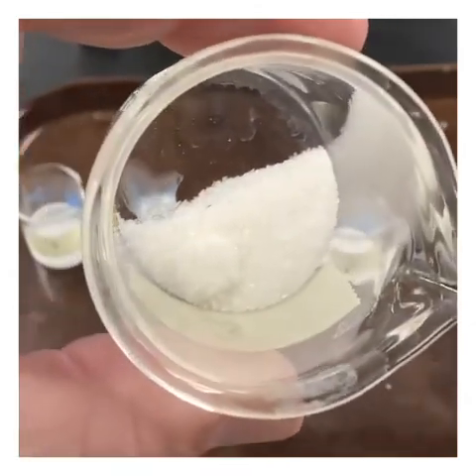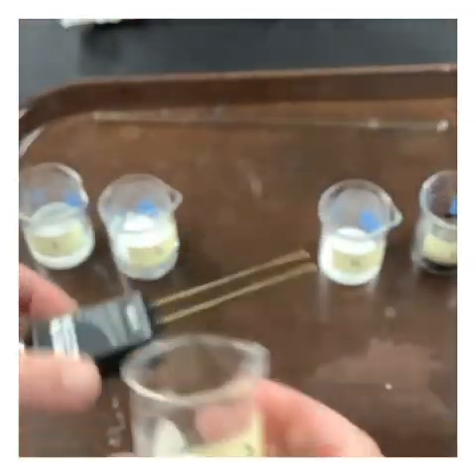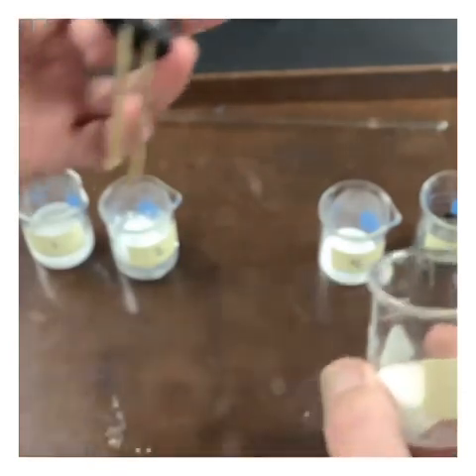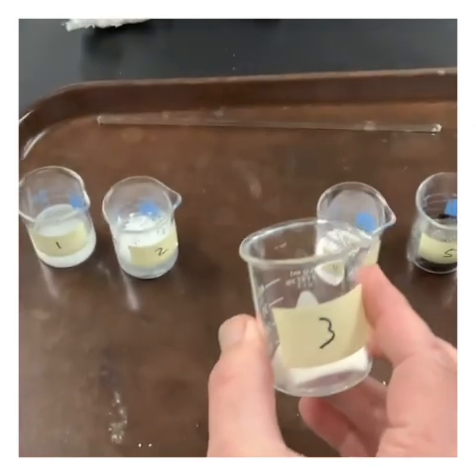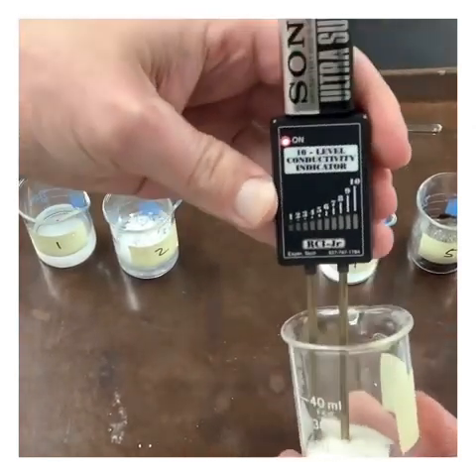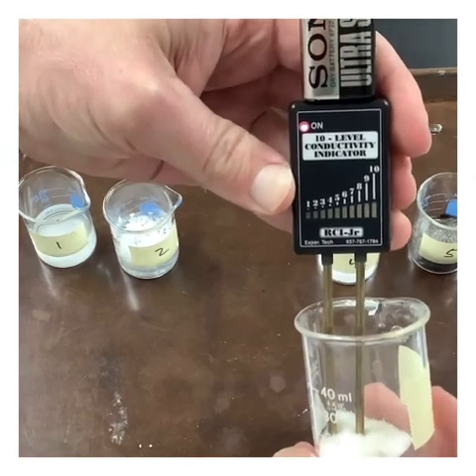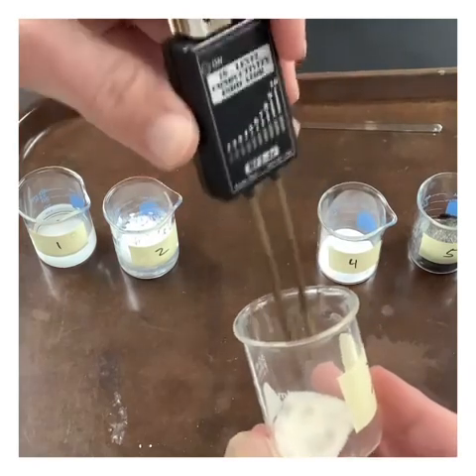Substance number 3. All right. Got it submerged in the salt, or it's not salt, I don't think, but whatever this is. No conductivity as a solid.